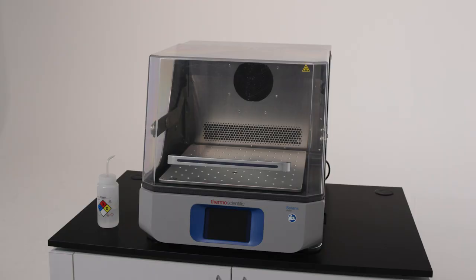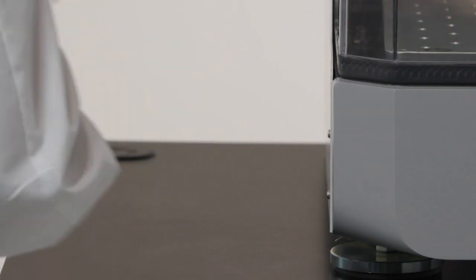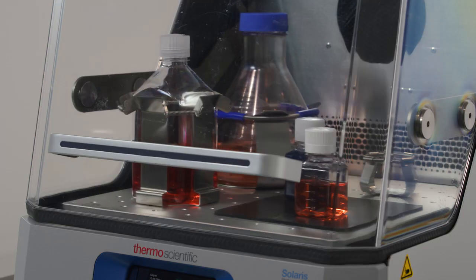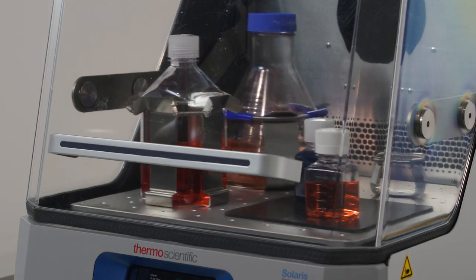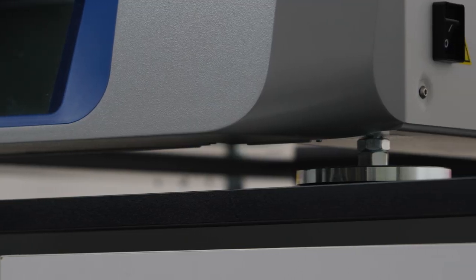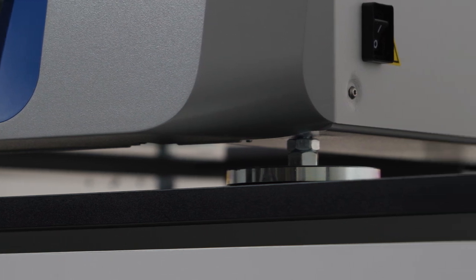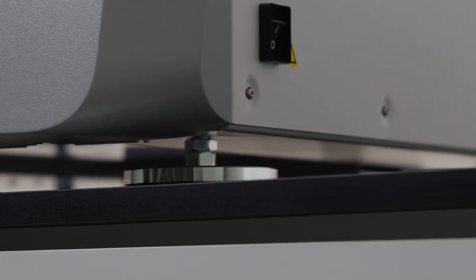Any sensitive or dangerous objects or substances should be removed from the area because the shaker may vibrate during use. Once you have the shaker set up, adjust the feet levelers to ensure that it's securely placed on your benchtop.